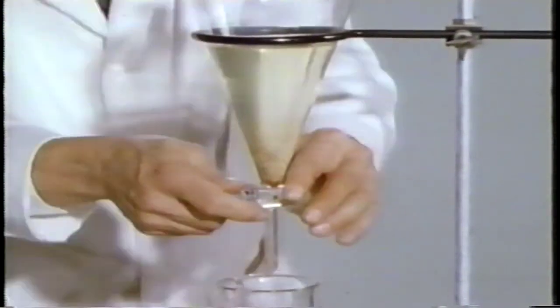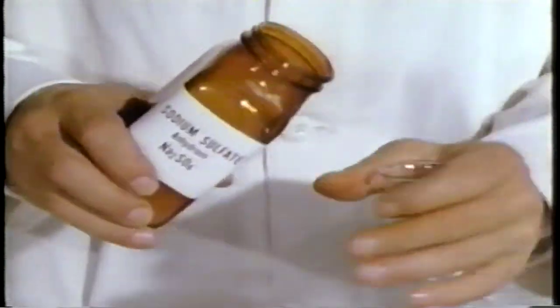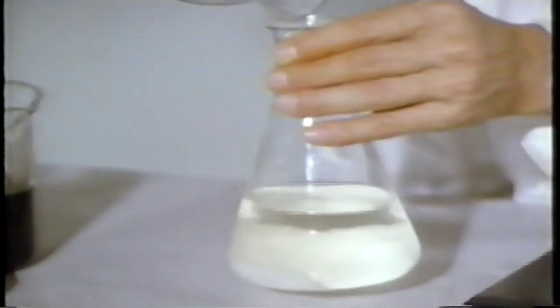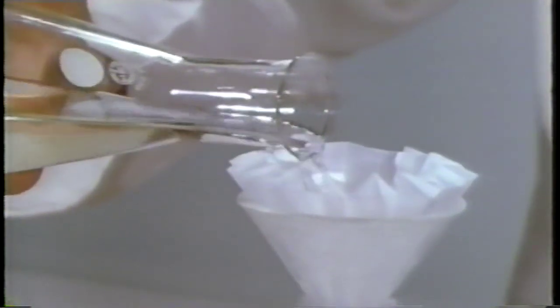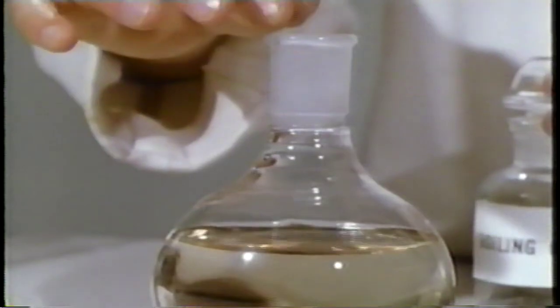The remaining ether solution contains some traces of water from the washing operations, as shown by the slight cloudiness. To absorb these traces of water, place solid anhydrous sodium sulfate in contact with the ether solution. A clear, dry ether solution of the ketone product remains. Now the ketone will be separated and purified by distillation. Remove the solid drying agent from the ether solution by filtering the solution into a distillation flask. These small boiling chips of porous material promote the formation of bubbles and help the solution boil smoothly.